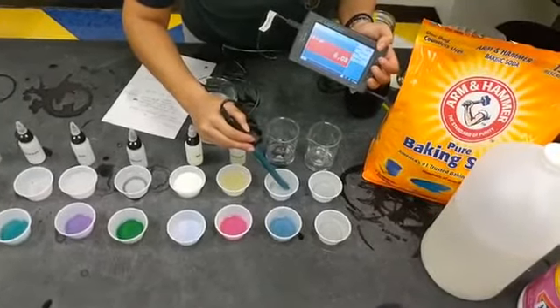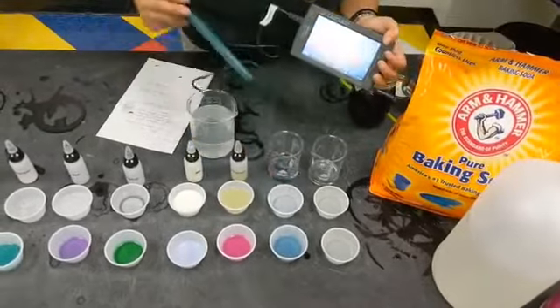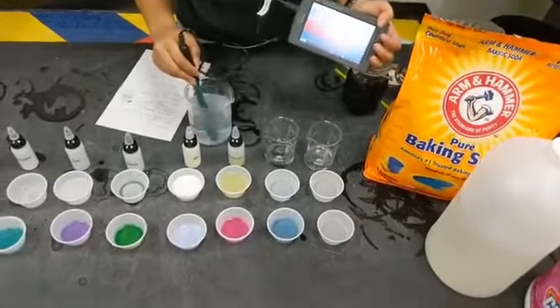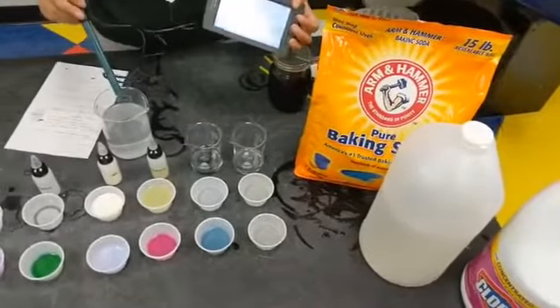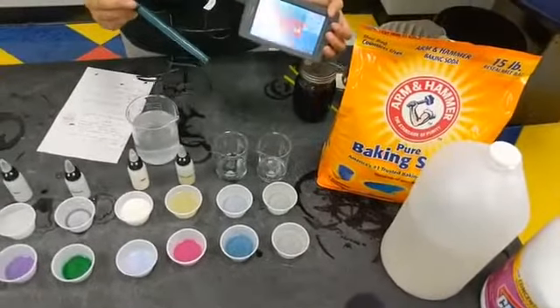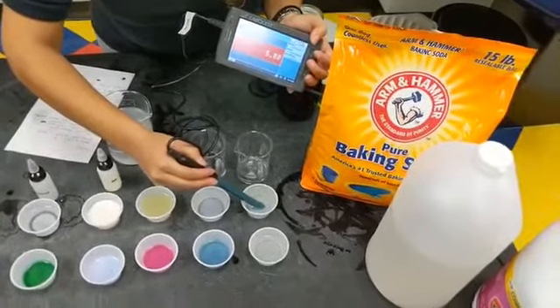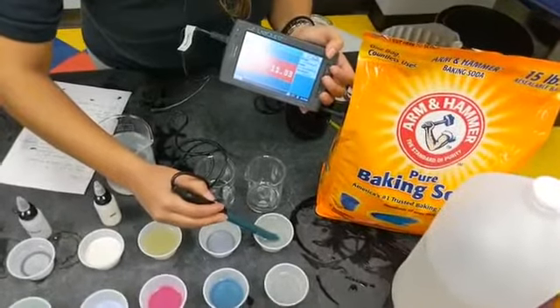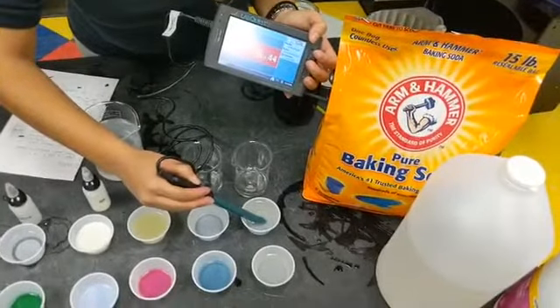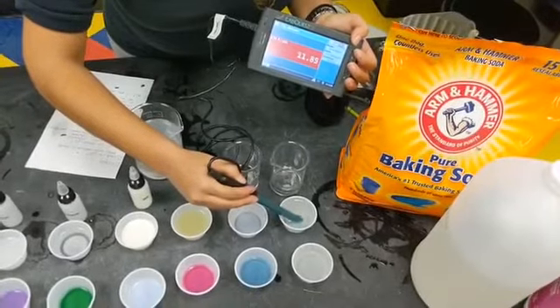Right, so we're back in the neutral range here. And then our very last sample is bleach. So if you can see, our indicator has now disappeared because it's bleach, and bleach tends to bleach out color. So I'm glad we looked at it while we still had the pH indicator in there. All right, our numbers are climbing pretty rapidly. So bleach is a pretty strong base.